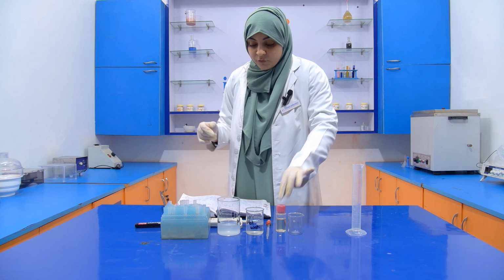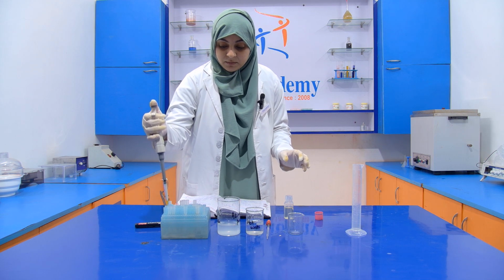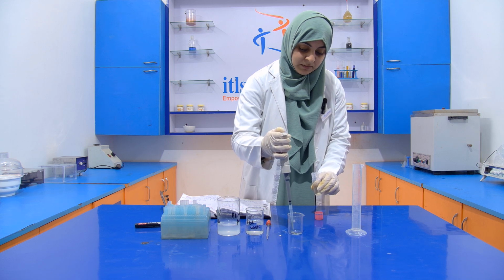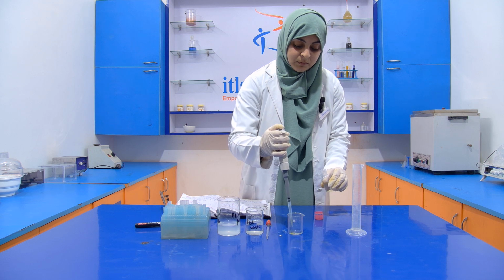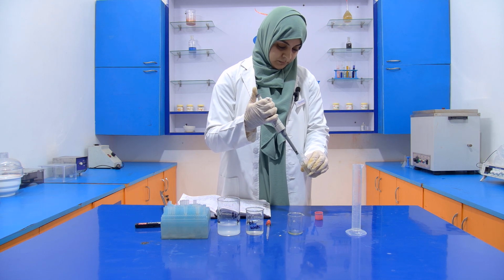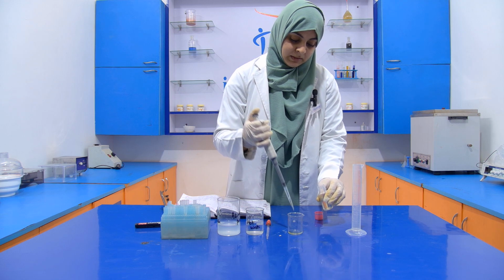Okay, now what we have to do, first of all we have to take a sample. Now we require 5 ml sample: 1, 2, 3, 4 and 5.